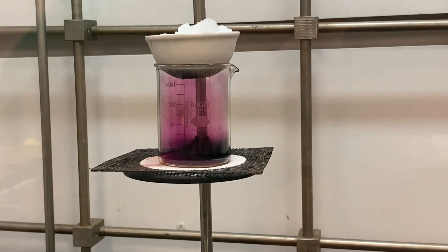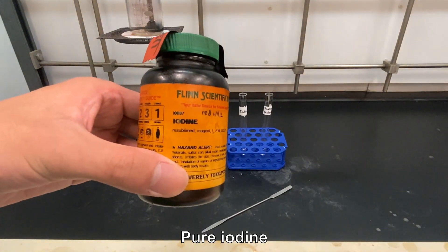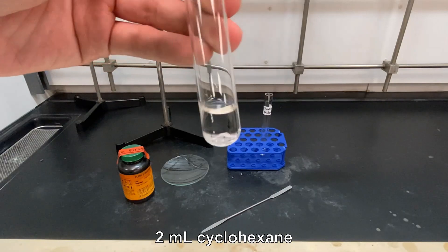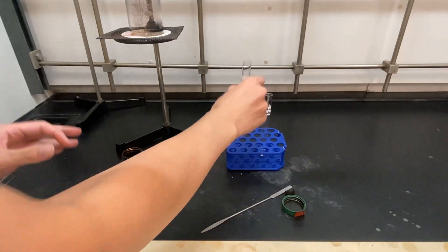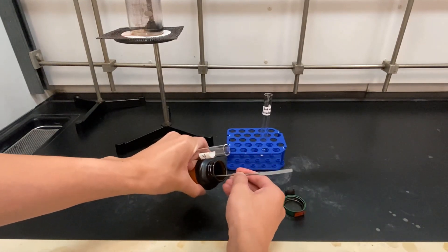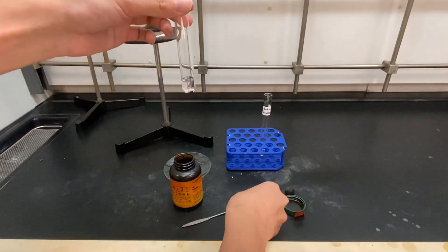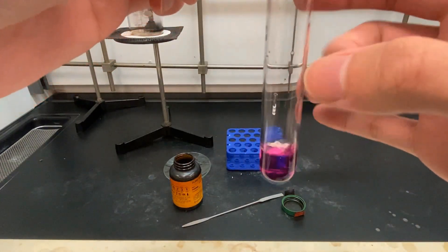In this test, we will be looking at the physical properties of iodine so we can make some comparisons. This test tube is filled with cyclohexane, a clear liquid. Using a scoop, a few crystals of iodine from the reagent bottle will be added to the cyclohexane. As the test tube is flicked, the solid iodine dissolves inside of the cyclohexane.